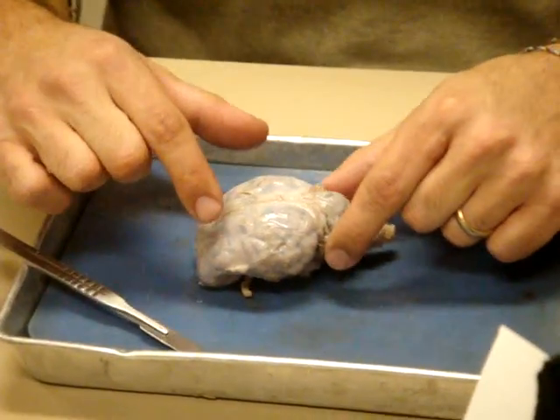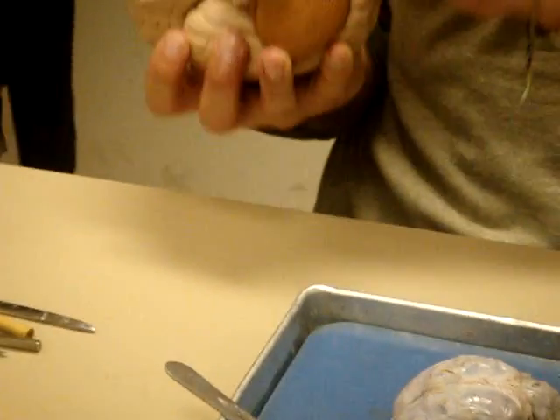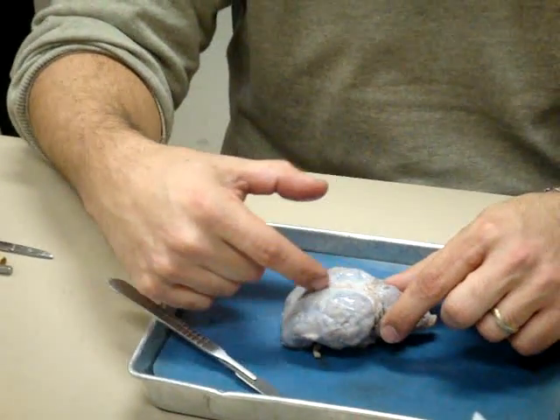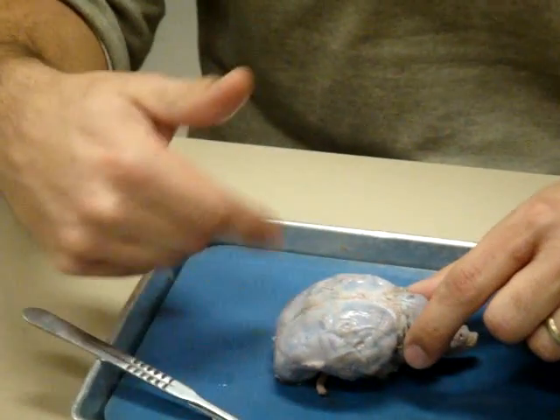This is where the cerebellum is right here. You can see it in the human brain, a little bit under the brain there. But in the sheep, it's a little bit more in the back. And then the brainstem coming down off of there. Okay, this would be the brainstem. Cerebellum is right here. You can see this is going to be the fissure between the two hemispheres. We call that the longitudinal fissure, but we'll see that once we get in.